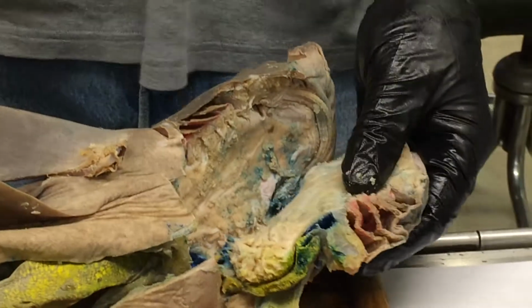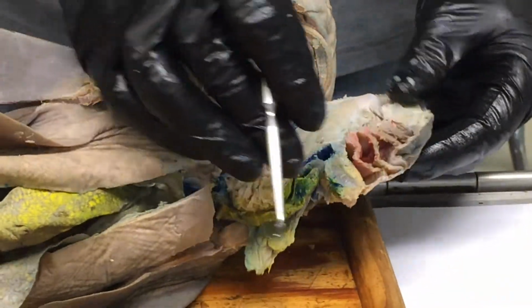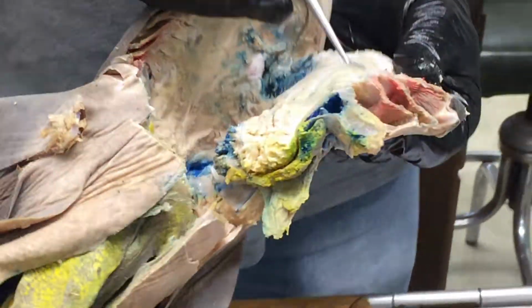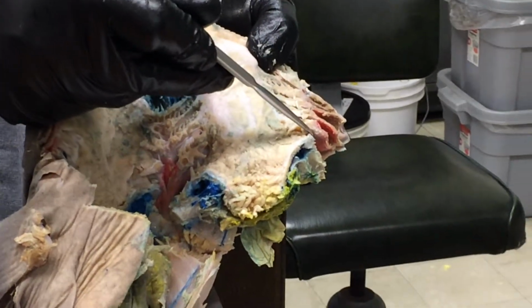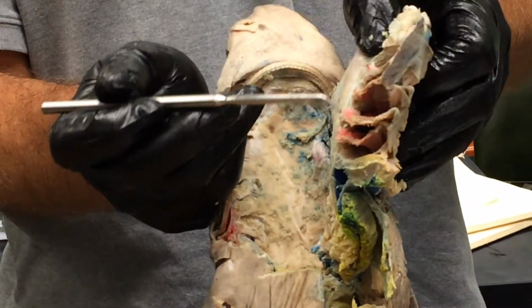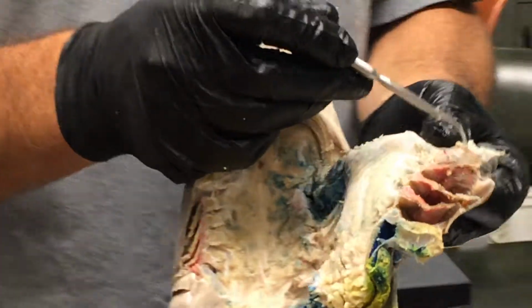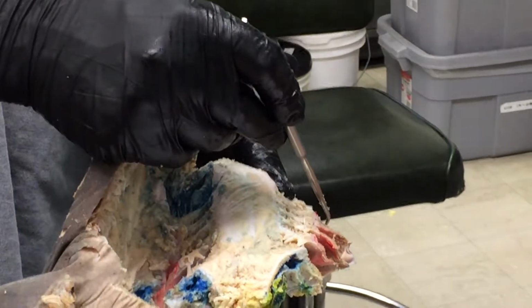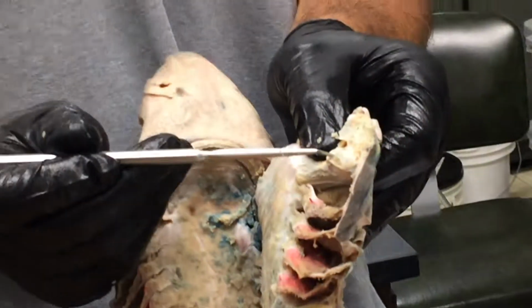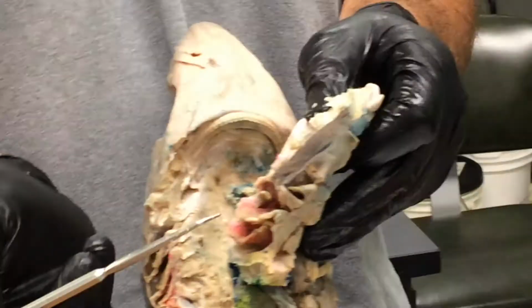If we pulled this out and stuck it under a microscope, we might be able to see them. Okay. Holobranch and hemibranch is kind of a funny terminology, but it just refers to the fact that some of these interbranchial septa have gills on both sides of them. So that would be a holobranch if there's gills on both sides, here and here. However, if we look at this septum here, the very first one, right there, there's only a gill on this side and not on the other side. So that's a hemibranch. Okay. So one hemibranch and a bunch, 1, 2, 3, 4 holobranchs in the shark.